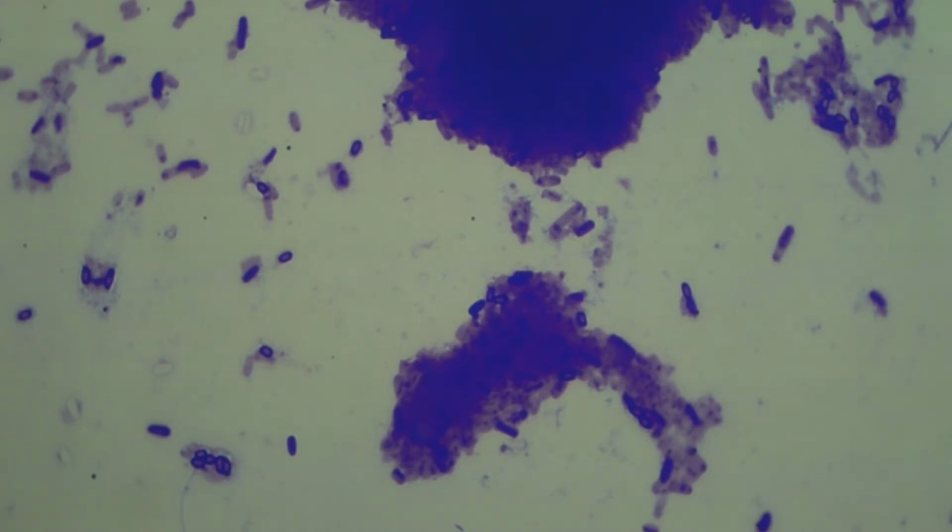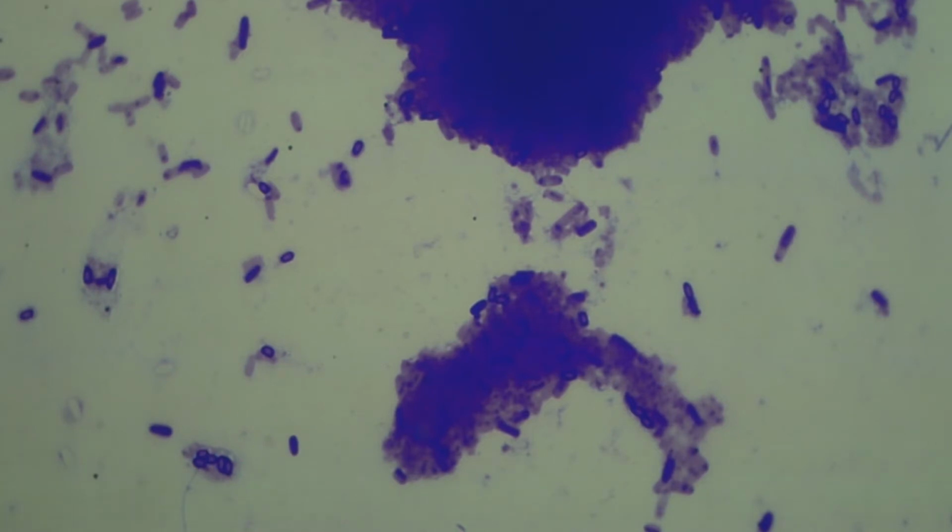So there are times when the cell begins to sporulate and the spore is actually seen inside the still vegetative cell, and there's other times when the vegetative cell has died, degraded, fallen away, and thus it is not taking up the dye, and what's left are the spores.